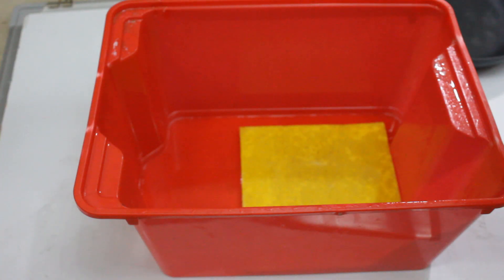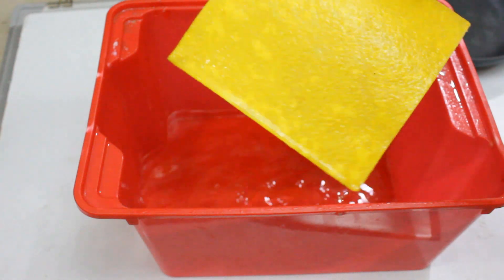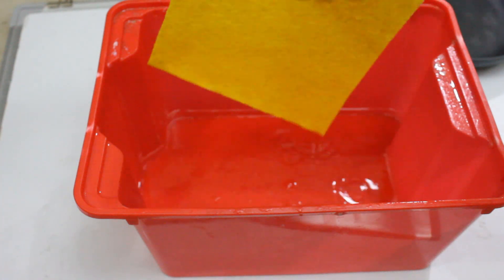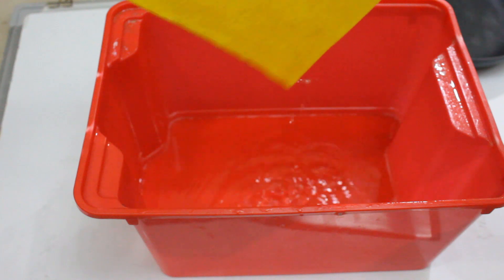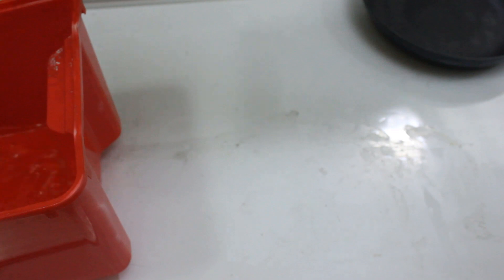Okay, so it's been a few hours and I have to go and lift this out of the bath now. Essentially I put something over it and now I've taken it off. Now it's time to lift this out. Texture is still really nice and soft. I'm just gonna lay it over here.